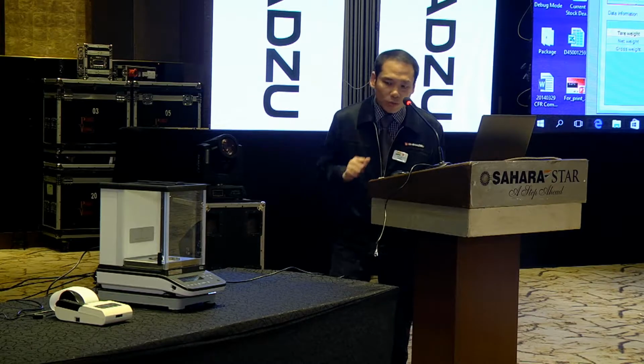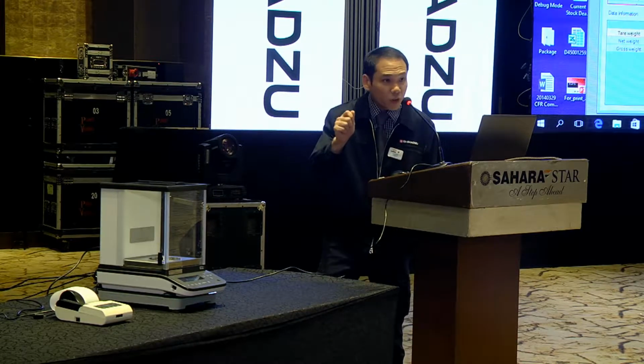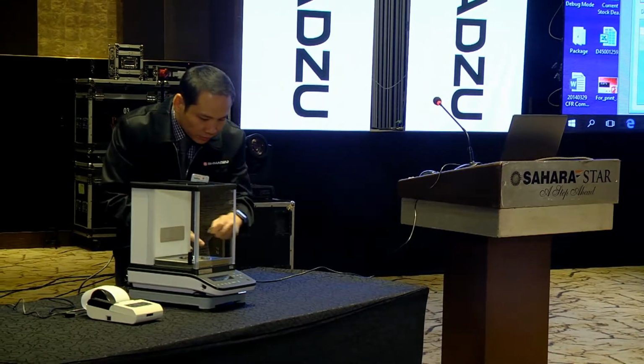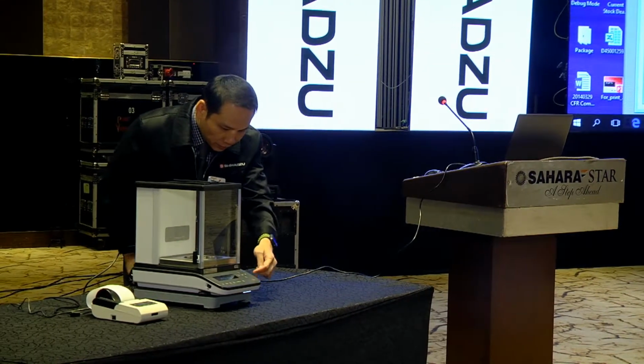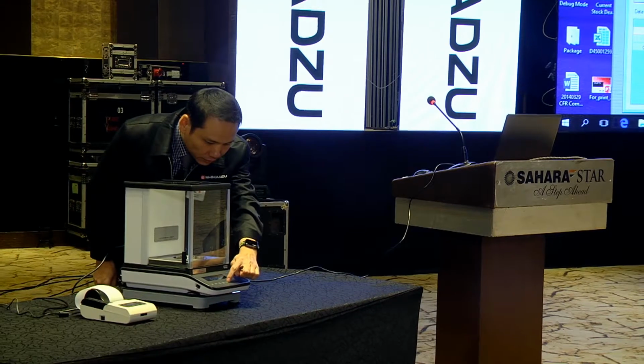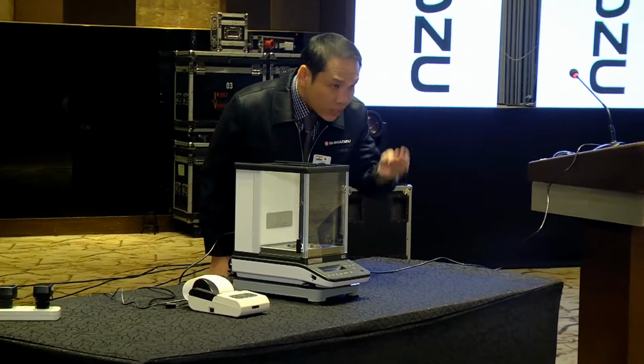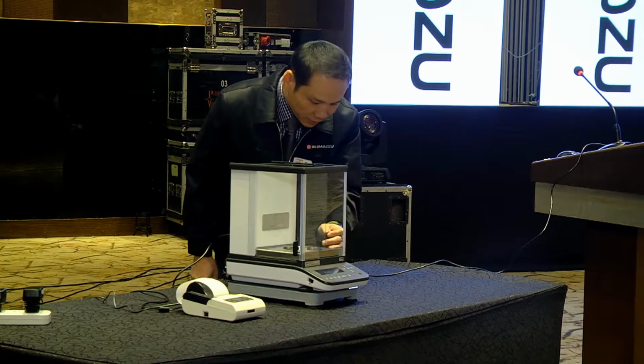Okay. So now the first step is I put on the container. Take this as a container.